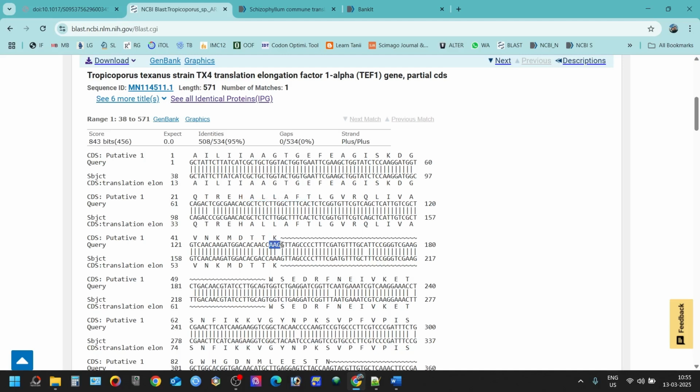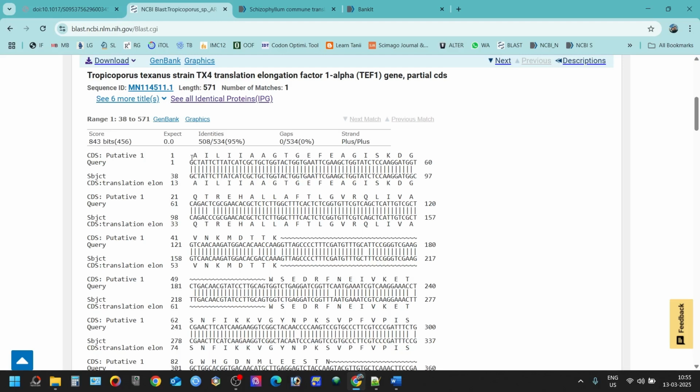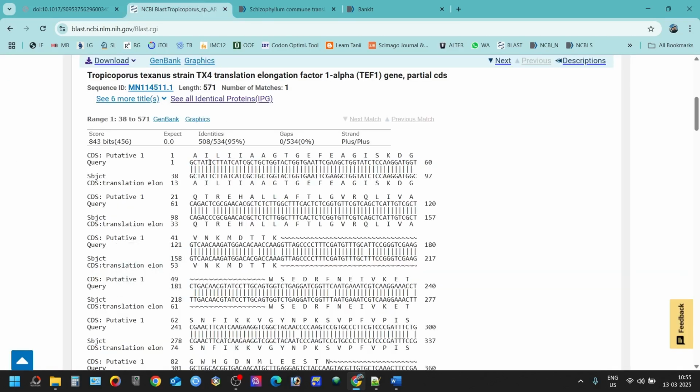And after this sequence, all the sequence you see, they are not coding anything because they are introns. So the exons, or the protein coding genes that we have here, we have to mention that here. I'll talk about this plus and minus strand later. Partially this one is later, but you have to click here and mention the gene regions that are coding for amino acid or protein. So you have to mention that.